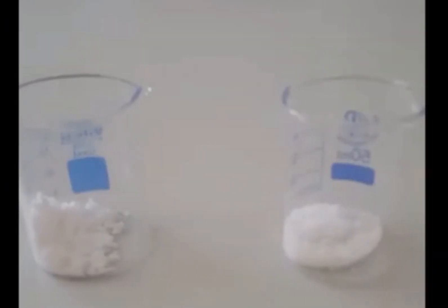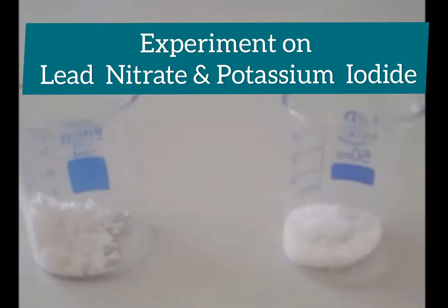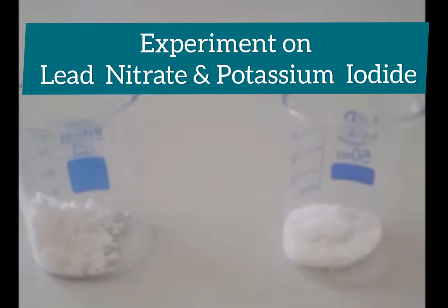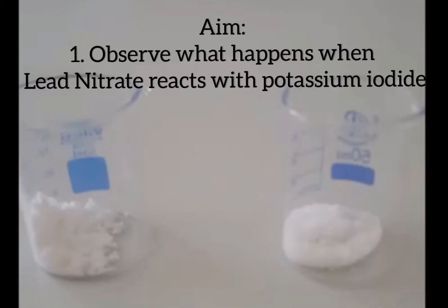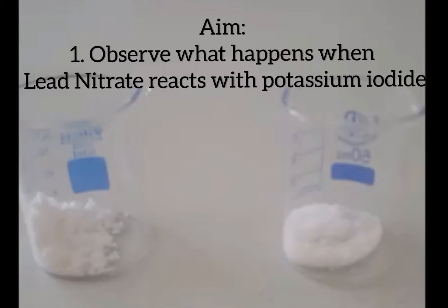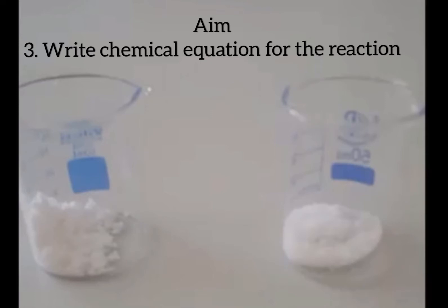Welcome to the practical session of grade 10 chemistry. Today we will conduct an experiment on lead nitrate and potassium iodide solutions. The aim of this experiment is to observe what happens when lead nitrate is added to potassium iodide solution, identify the type of reaction, and write a chemical equation for the reaction.